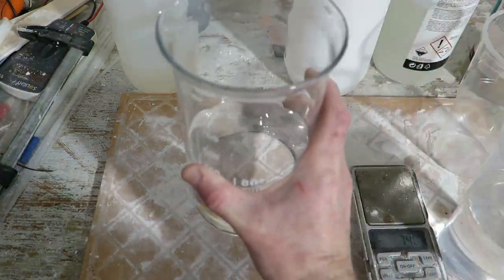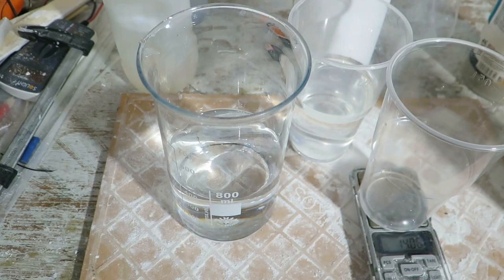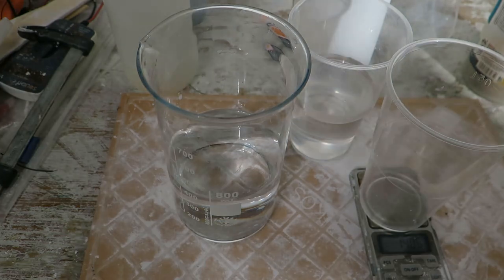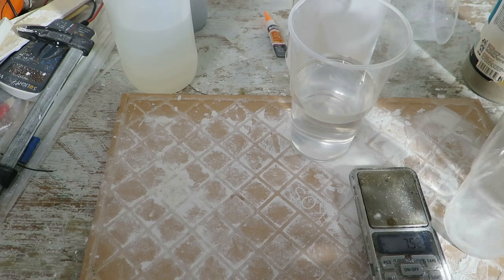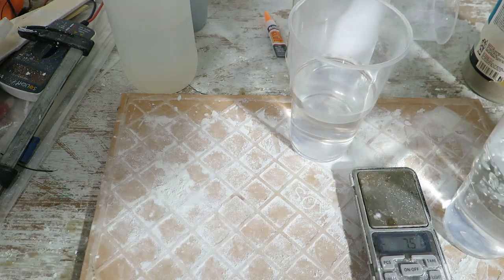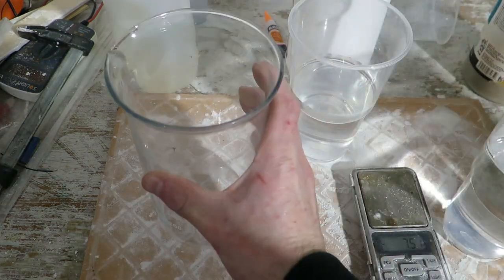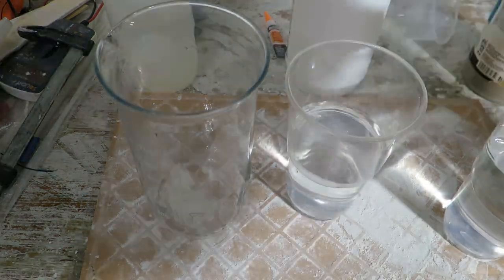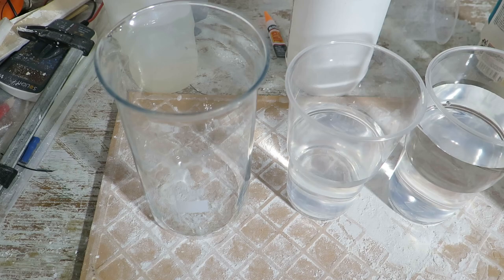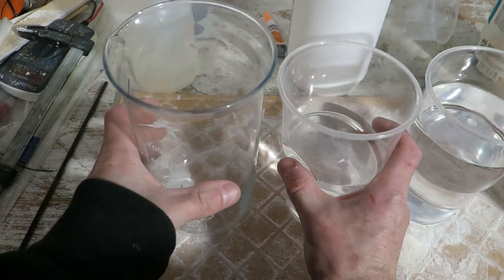Then in another plastic cup measure even more precisely 14 grams of hydrochloric acid. My point is that you cannot overshoot hydrochloric acid because you will not get silica gel. And pour remaining water from the beaker to the plastic cup with hydrochloric acid. Now grab both cups and pour them simultaneously back into the beaker.